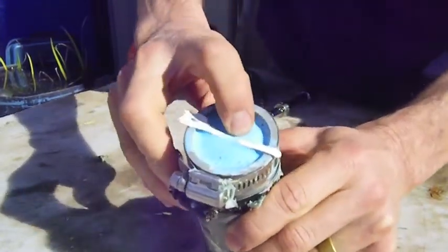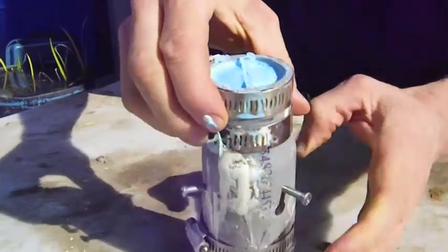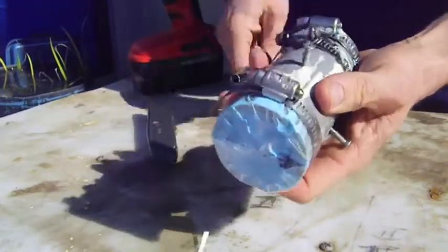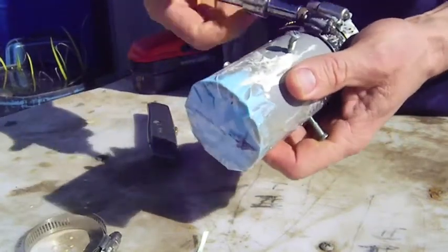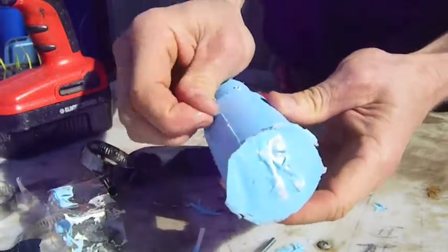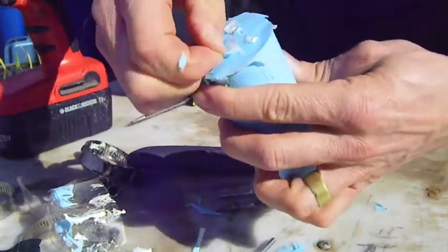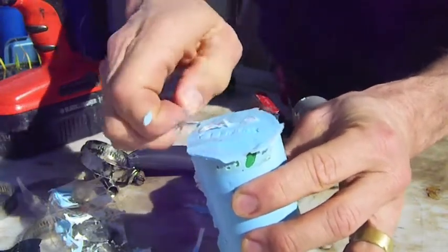It's been plenty of time for this to set up. I put this little piece in here to help me tell which way the tooth is oriented inside of there — also got a mark right there. I'm actually going to slice right here so that I know where I want to go in to get the tooth out. Remember, inside of there is a killer whale tooth. The little white pieces are the sample number, so I can remember later which tooth this is. This is the Gravena tooth.